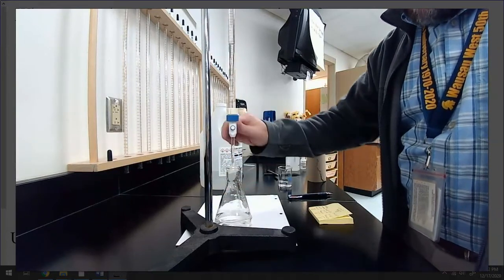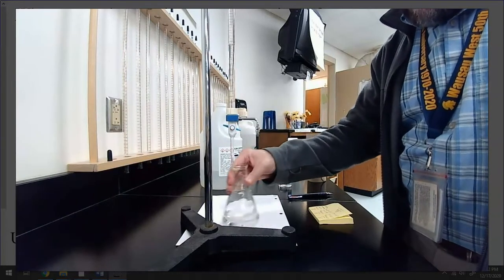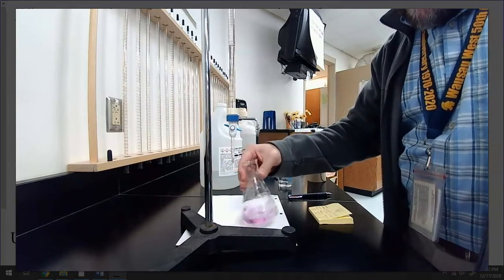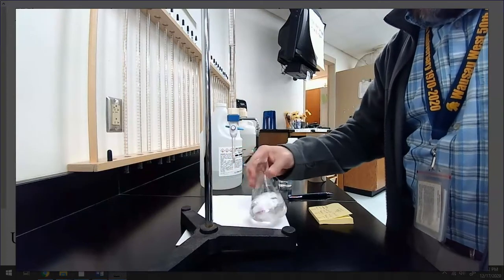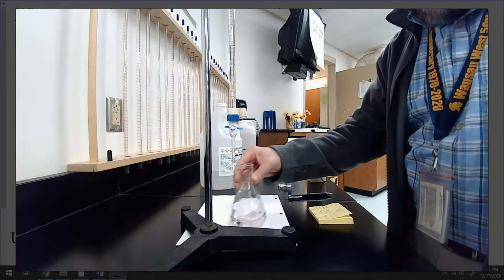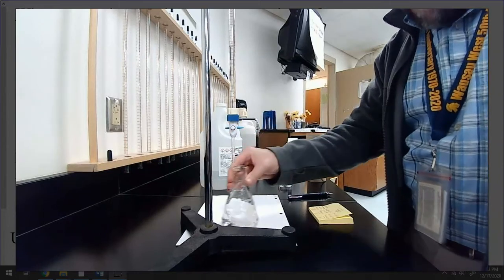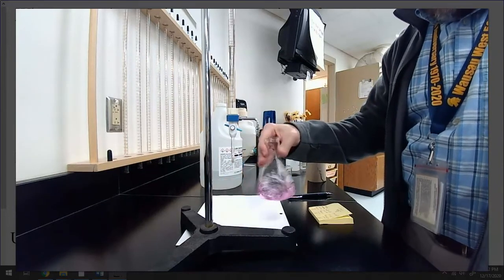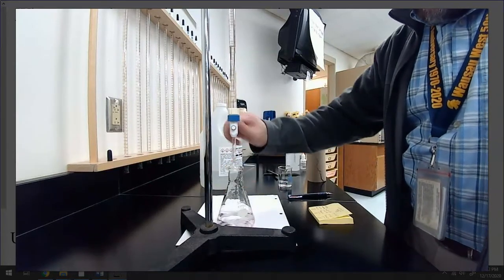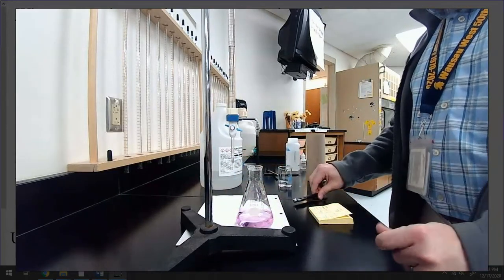Oh, come on. It's fighting me. Now we're on it. There we go. Maybe one more. One more. All right, one more. There we go. Okay, so we're there. I have reached the end point of the second trial.